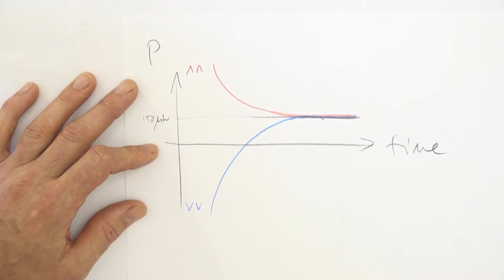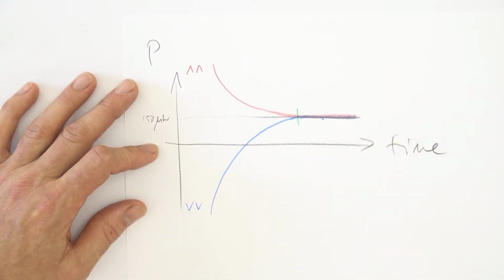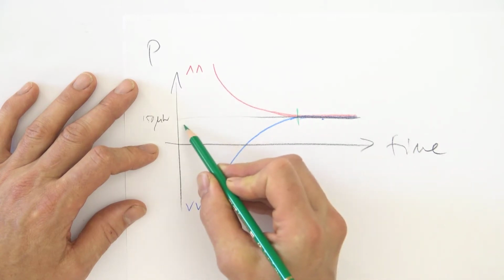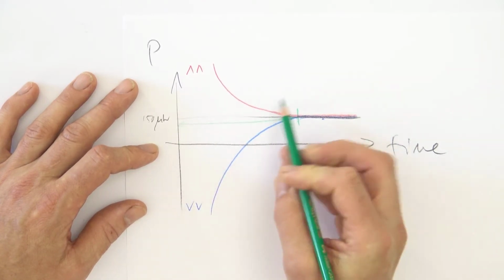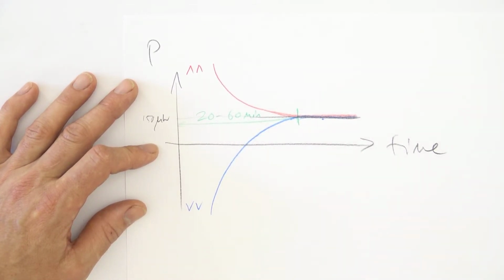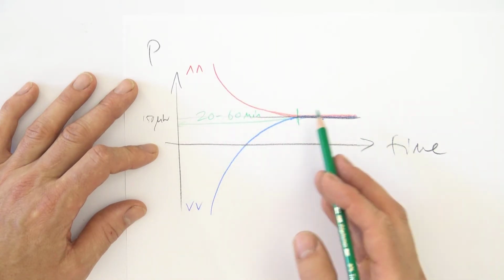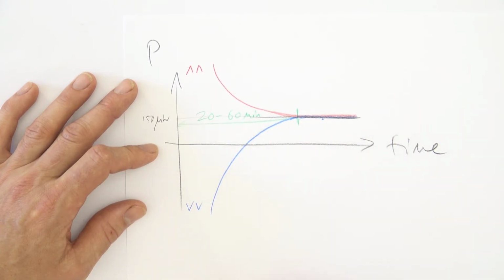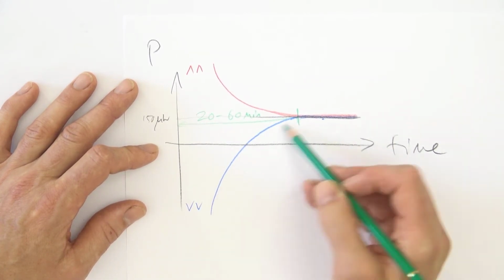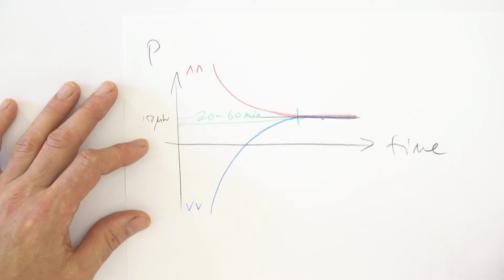So this is what happens when the temperature in the room is higher than the temperature in the calorimeter. And if it's lower temperature in the room, we end up at typically out of range values, but on the negative side, and then get an exponential decay back once more to the thermal power of the insect, the true thermal power. So it does take some time to come to the time when we are measuring the true thermal power of our sample. And this time is typically 20 to 60 minutes. And before this, we have these exponential decays plus the thermal power of the sample. But these exponential decays, remember, are just artifacts. They are apparent thermal powers. They are not true thermal powers from the sample.